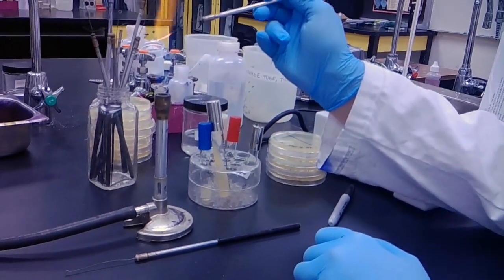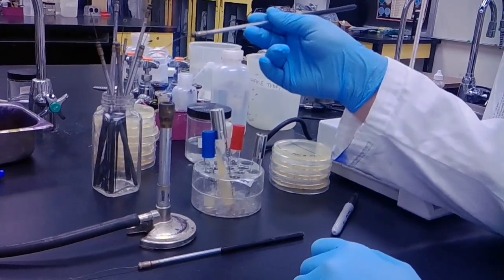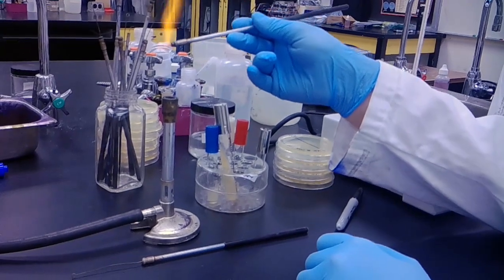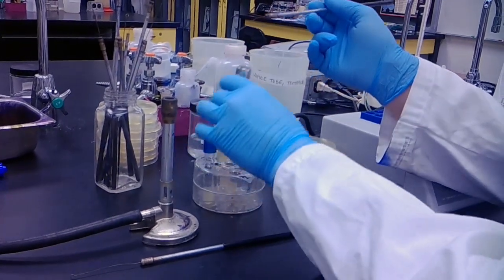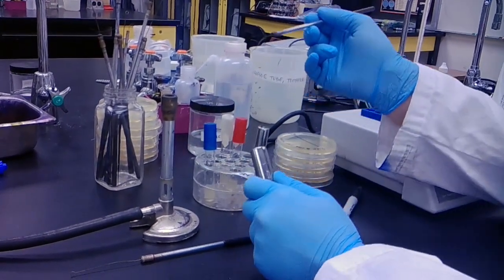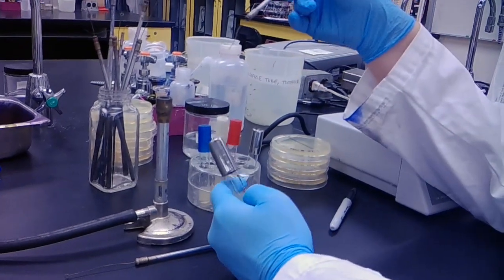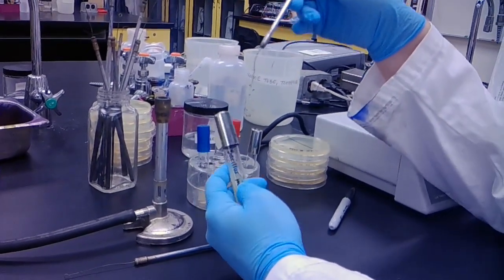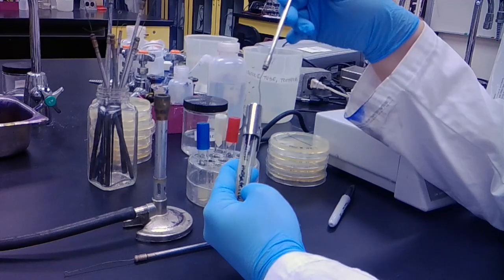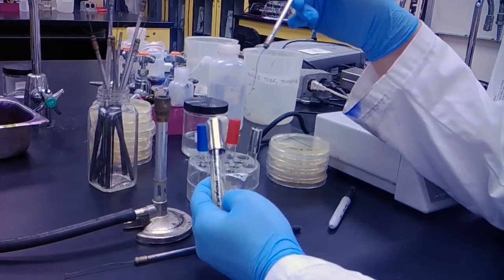I'm just going to quickly warm it up, then wait a few moments before I put my collection rod into the bacteria so that I don't kill off my bacteria on collection.